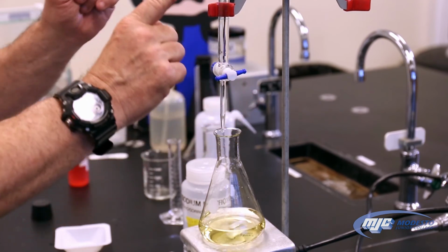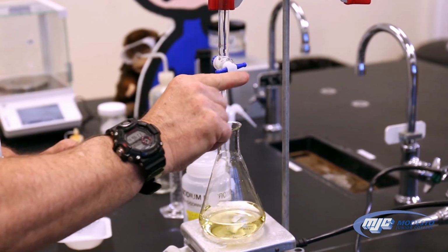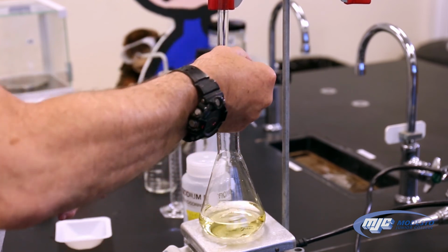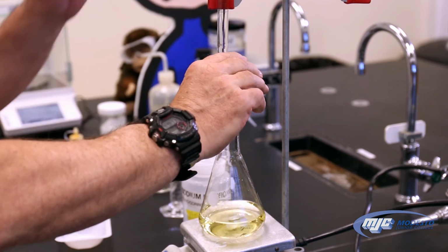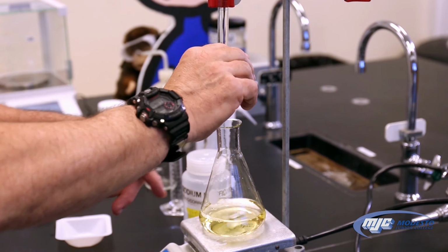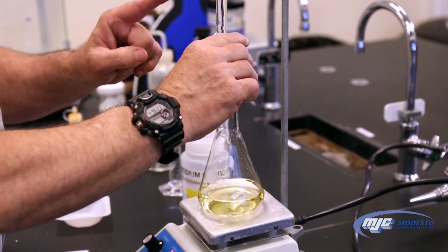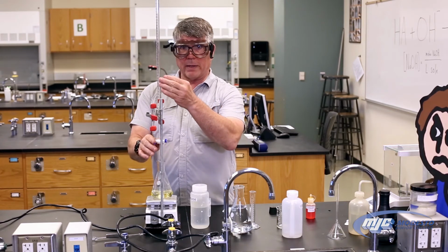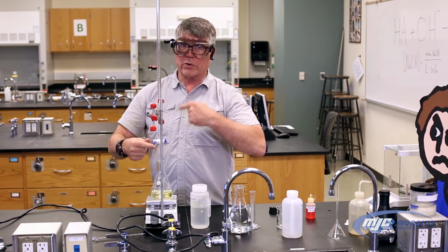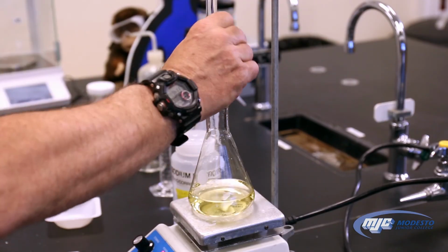So now, when I start, I made sure I read my initial volume. I'm going to twist this stopcock 180 degrees each time. And at first, it looks like nothing's happening. Patience is the key to titrations. Actually, I saw a little splash of green in there, so I'm going to twist a little faster. The thing with a burette, the faster you twist the stopcock 180 degrees, the slower you're going because less comes out each time. So if I go like that, I'm going slower.